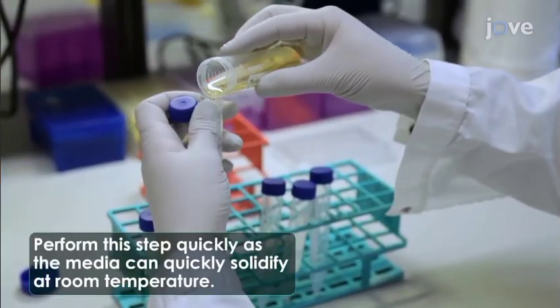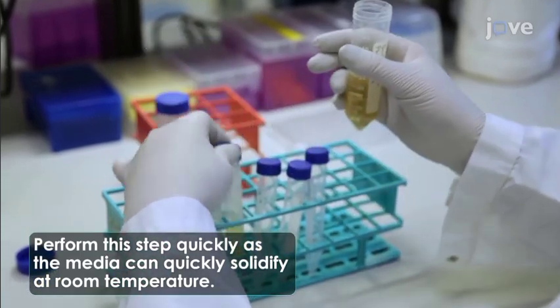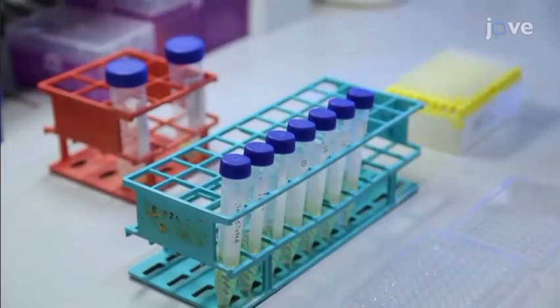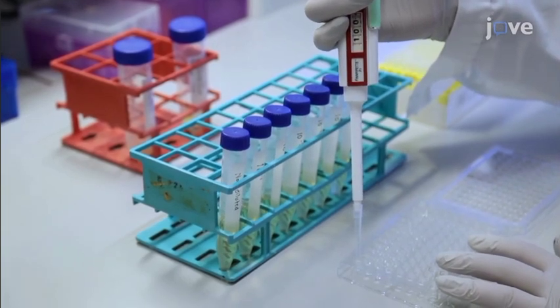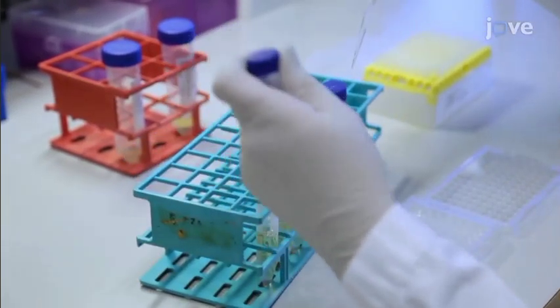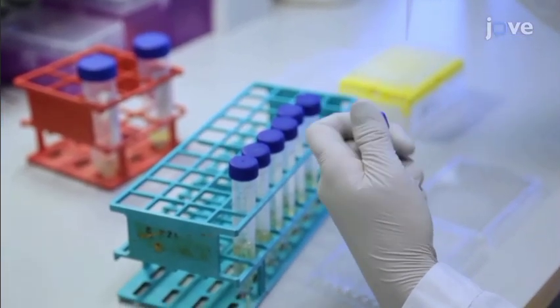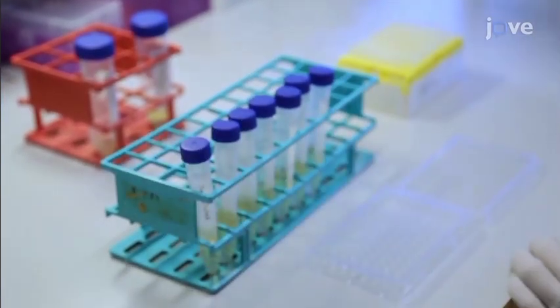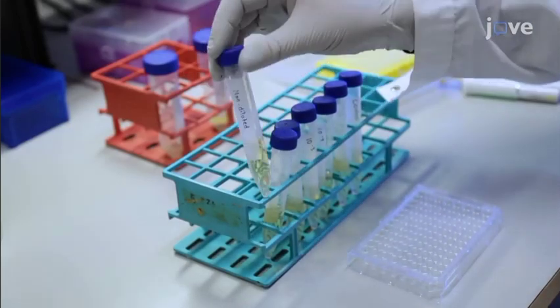Now, aliquot 5 milliliters of this bacteria top agar mix into each of the 7 test tubes. Then transfer 100 microliters of each of the serially diluted bacteriophage samples and control media, which should be simply media with no bacteriophage, to the respectively labeled test tubes. Swirl the mixture gently to ensure proper mixing.